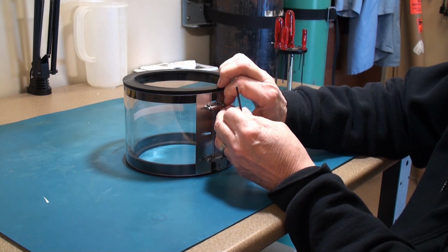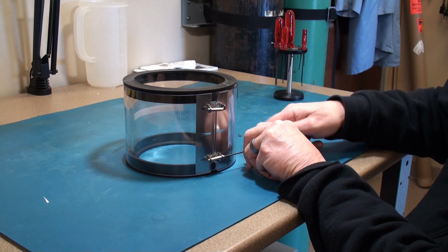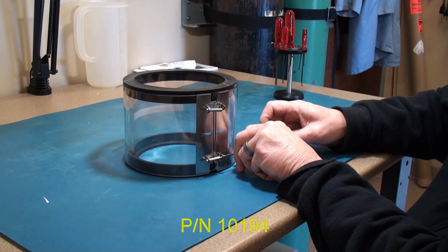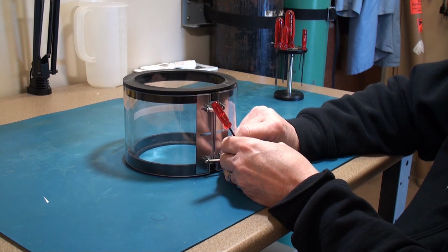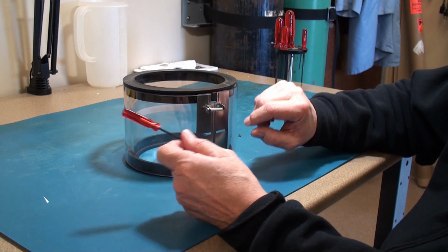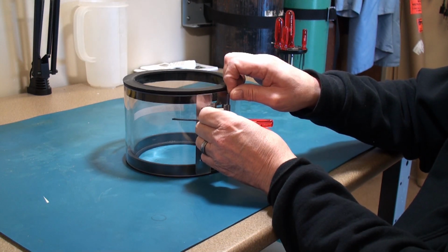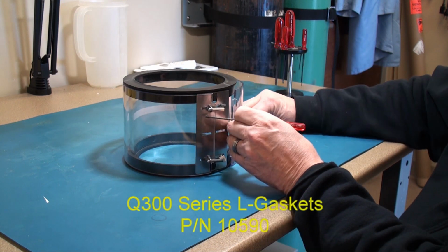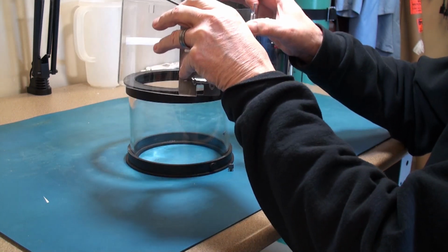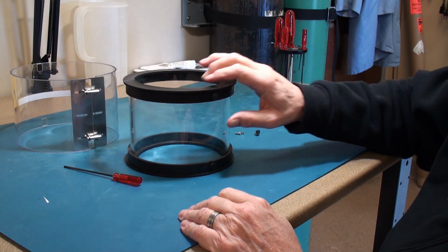And the first thing you do is unscrew one side of the Allen key and remove this hex bolt from this side. Try to leave one side intact. It makes things a little easier. Then you need to pry off the implosion guard, which covers the glass cylinder.